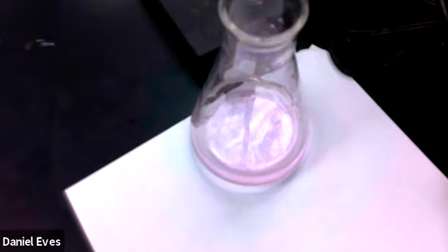And then we take that concentration and average it, and that would be our concentration of sodium hydroxide moving forward. Okay, so now that we have calculated the concentration of our sodium hydroxide, we're going to want to identify some unknown acids. So I'm going to go prepare those solutions now.